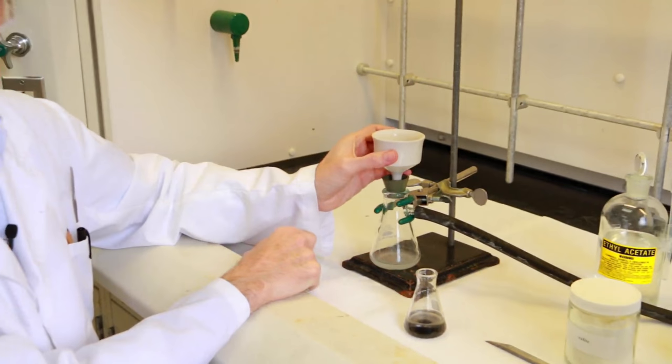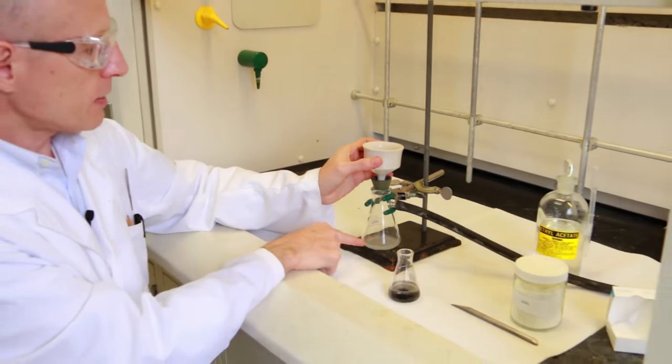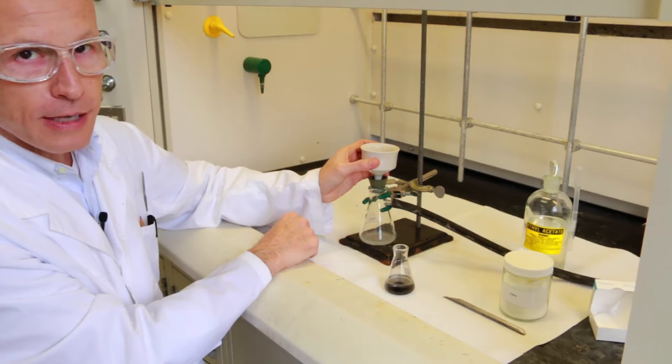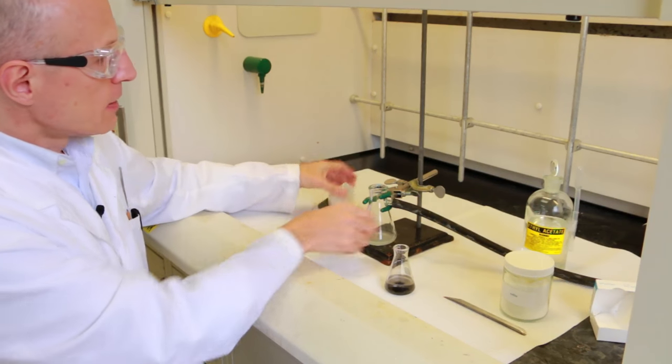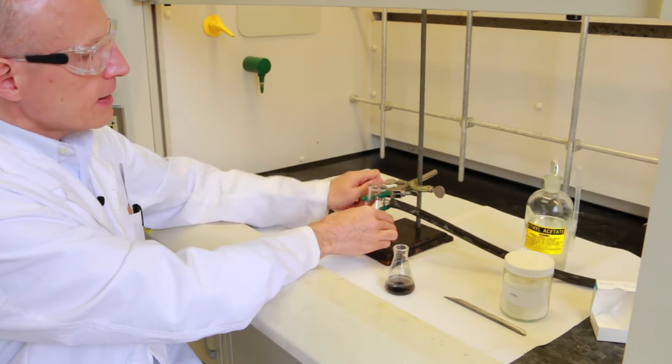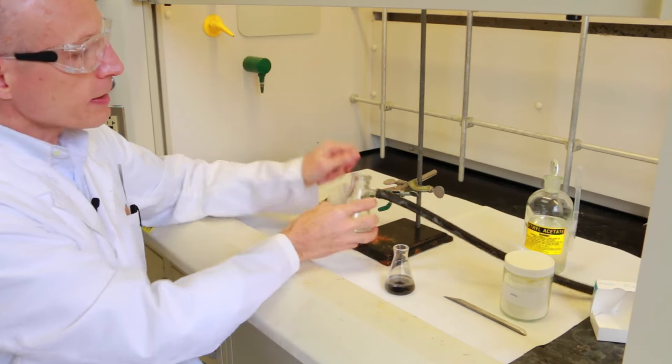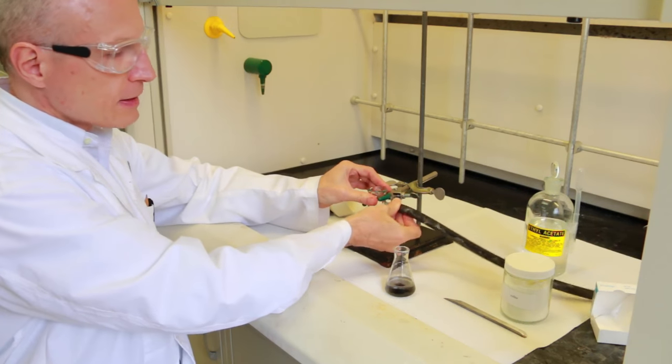It might happen that some of the powder goes through and ends up in your filtering flask. This is normal. The only thing you have to do is remove the filter, wash the filtering flask, and come back with a clean flask. Now you are ready to filter.